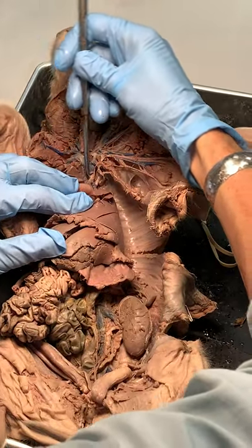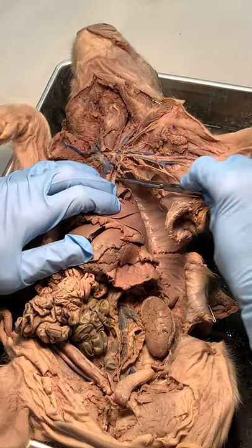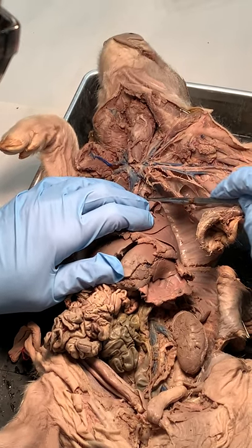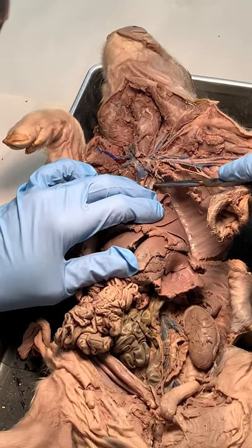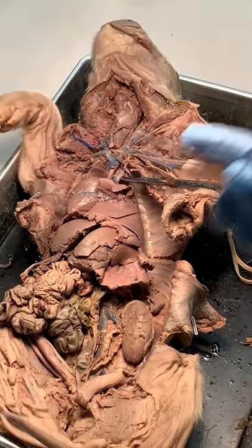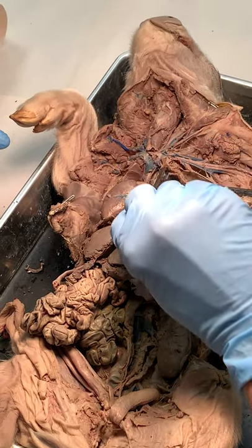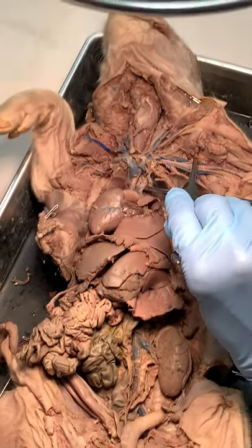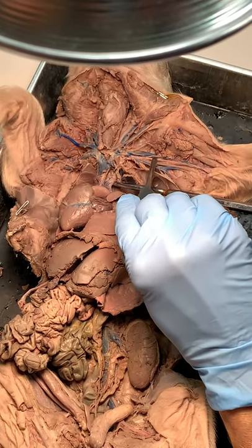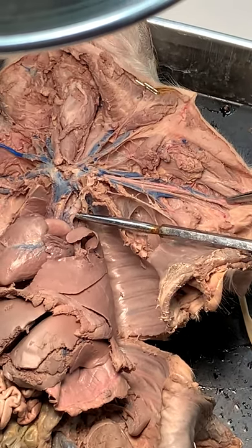Let me draw that again. I've got the left subclavian going out to the arm — just like this was the left subclavian vein, this is the left subclavian artery going out to the arm. Once you find the red one over that open space, it's axillary, and then on this pig there's a little brachial because we're on the arm.